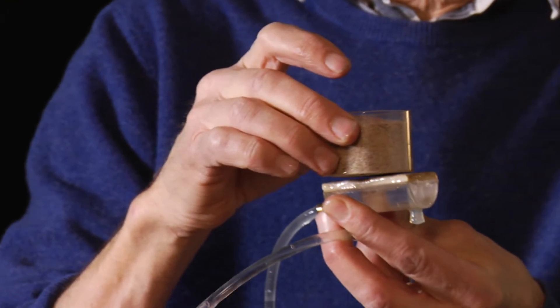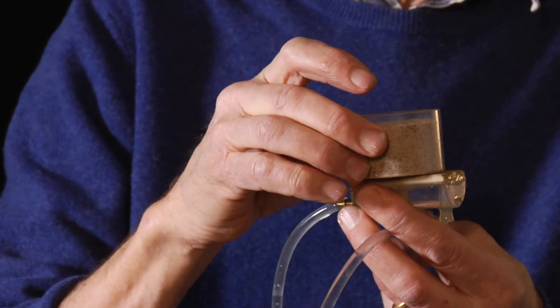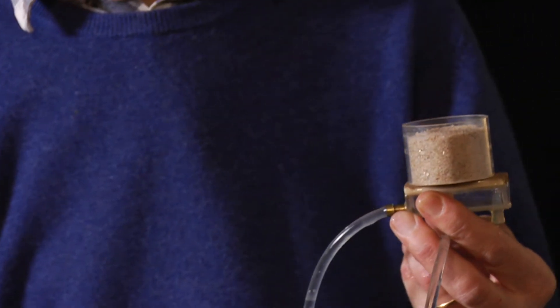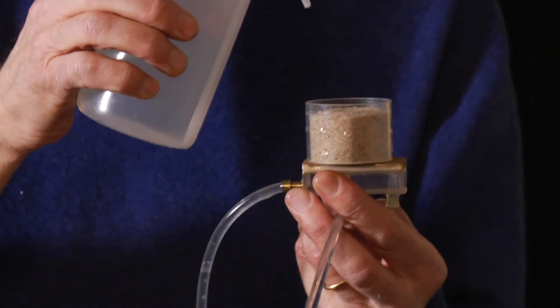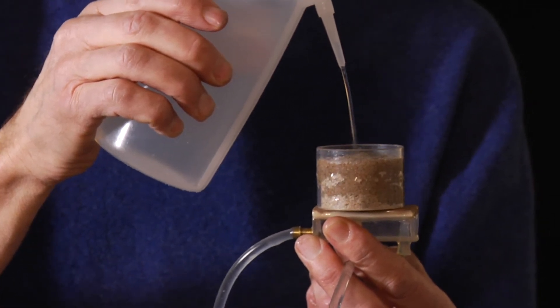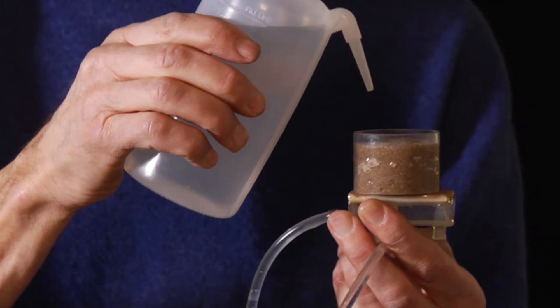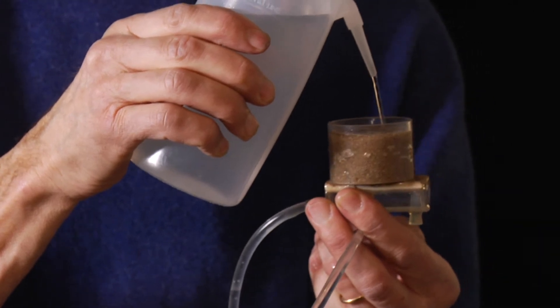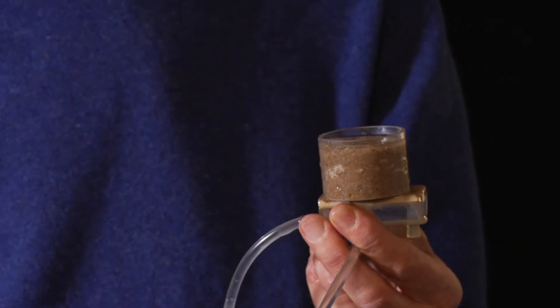Now I take a real soil, a small cylinder with sand having a nylon mesh as bottom. I put it on the plate and supply it with water. The soil darkens as it becomes wet. I saturate the whole system with some overflow.